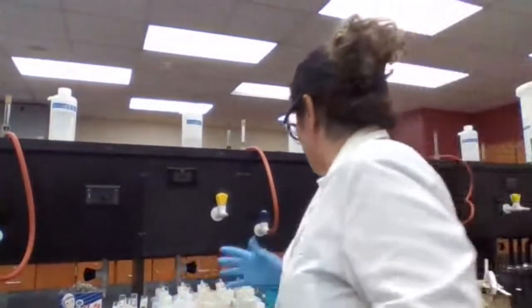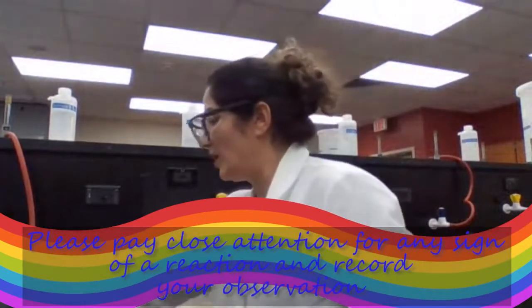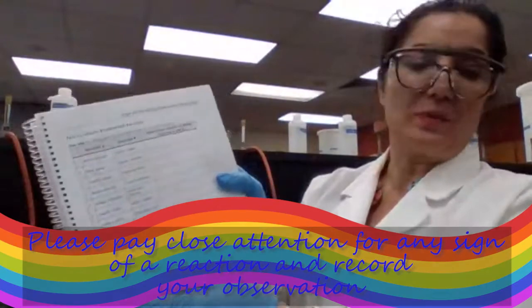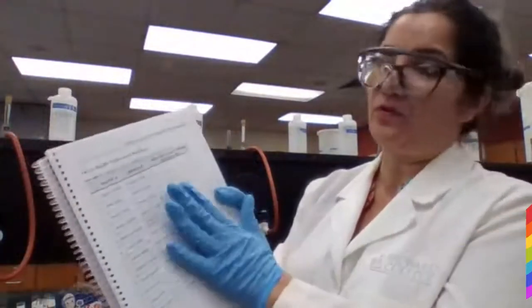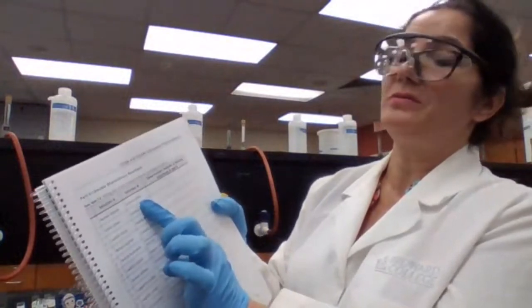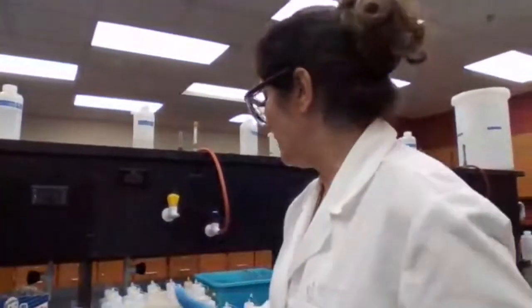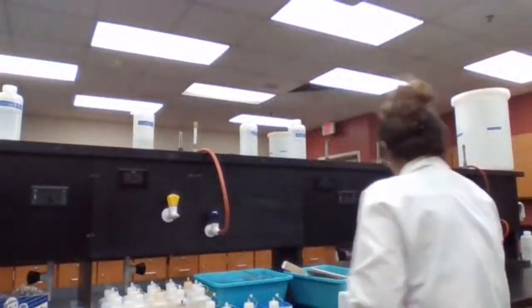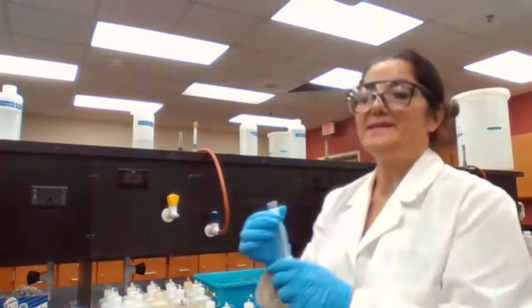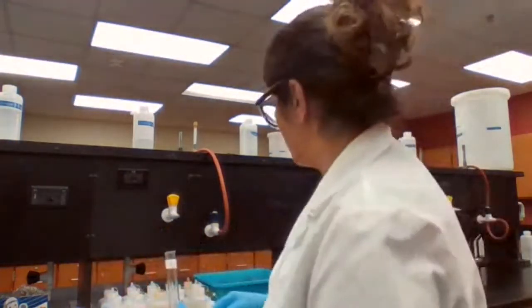Okay, I'm going to start with the test tubes. I'm going to label the test tubes 1 to 12. I'm not writing these formulas on the test tubes because I have the table to follow. I know for test tube 1, I'm going to add barium chloride and sodium sulfate. So I'm going to take my test tube 1 and add the barium chloride and sodium sulfate.